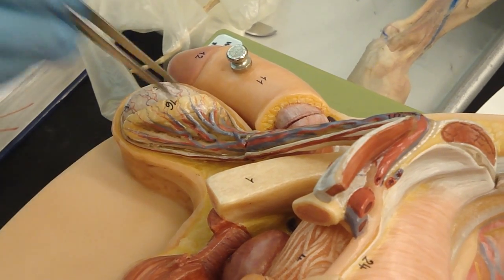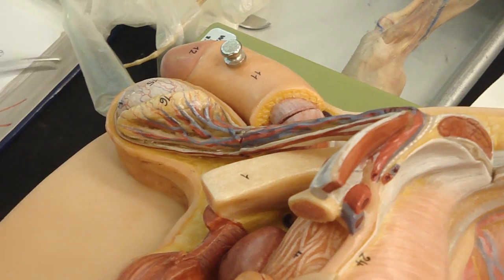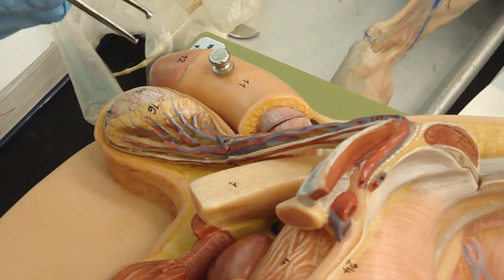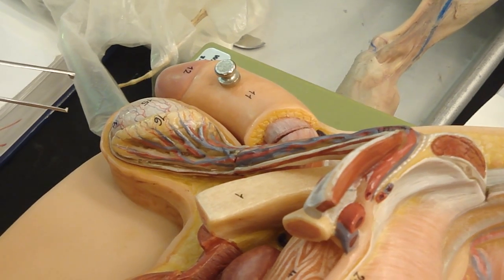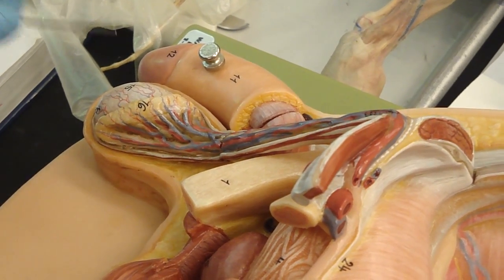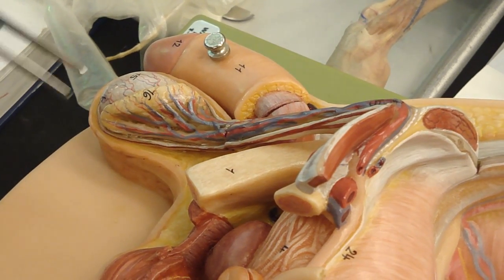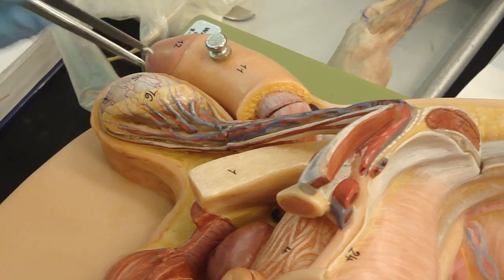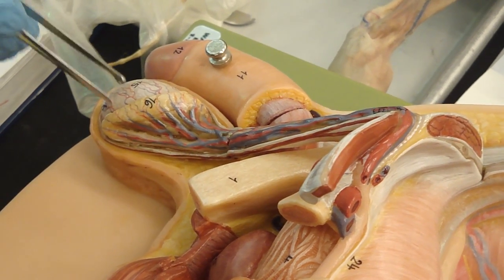So you've got to cut the scrotum on the left side, and then go and do the same thing on the right. If they do that, they cut the vas deferens, they push it back in, they don't suture it. You guys in the vet clinics, when you do the cat, you don't suture it back up, do you? No. So just push it back in there, don't suture it. Can that cat, well, that person, can it inseminate?